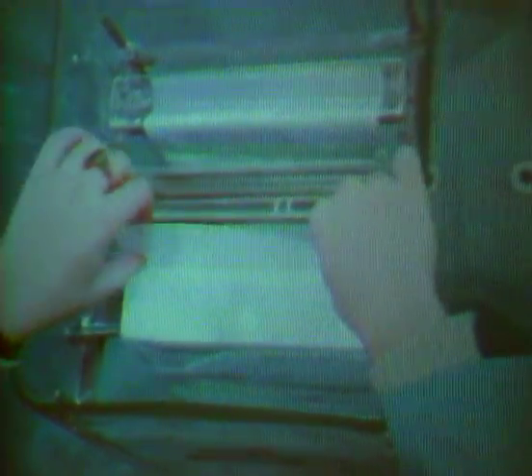The spotted paper is placed in a chamber kept closed to prevent evaporation of the liquids. In some setups, the solvent travels up the paper, known as ascending paper chromatography. In others, it travels down the paper, descending paper chromatography.